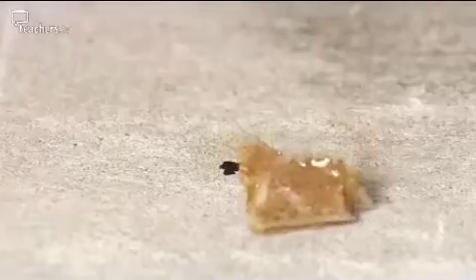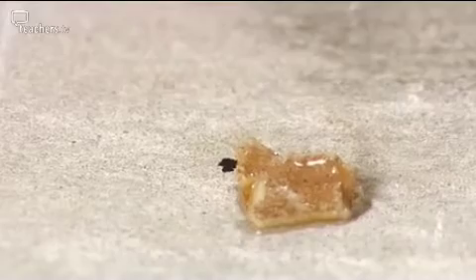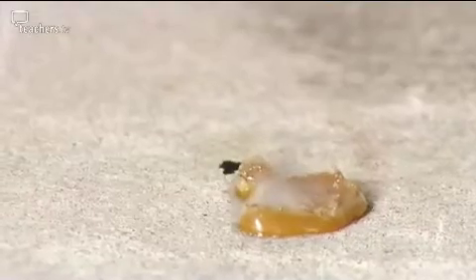If we just put a tiny little piece of phosphorus on this heat-proof mat, you'll see what can happen. So, yeah, that's what happens. Can you see some bits are actually spitting off, and you can get bits around. But it's quite a violent reaction. If this does happen, immediately cover the phosphorus to cut off the oxygen and contain the fumes.